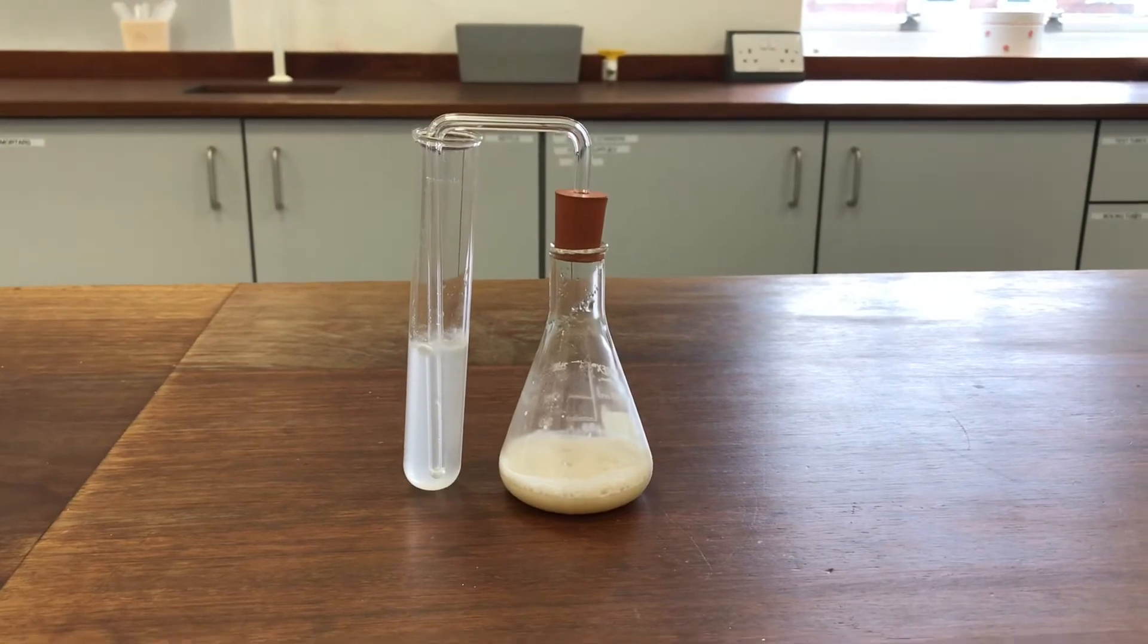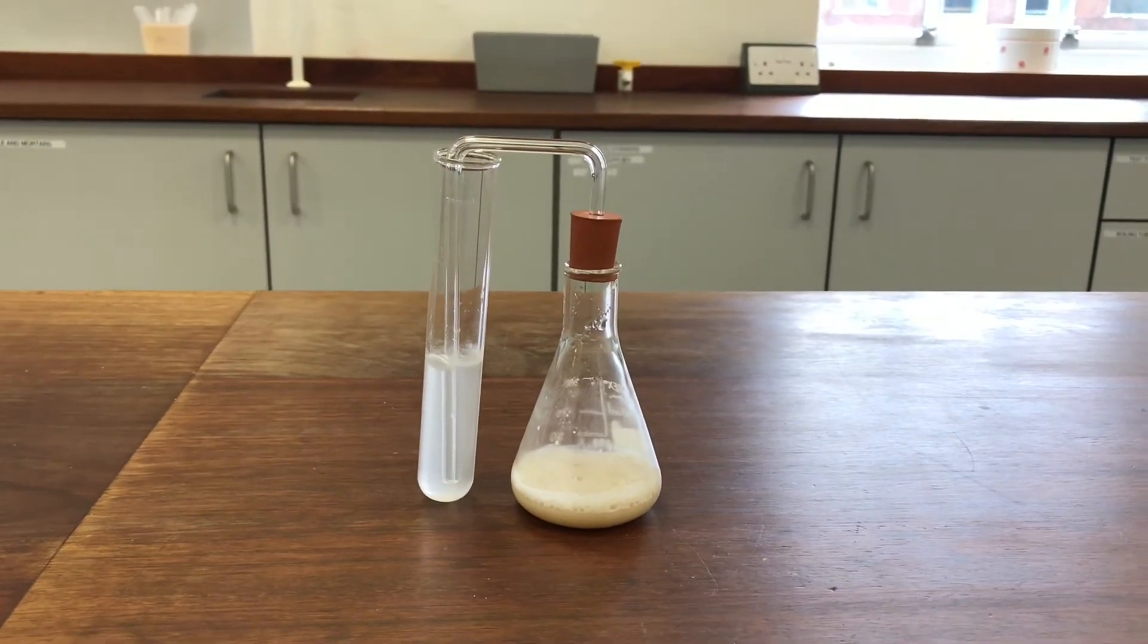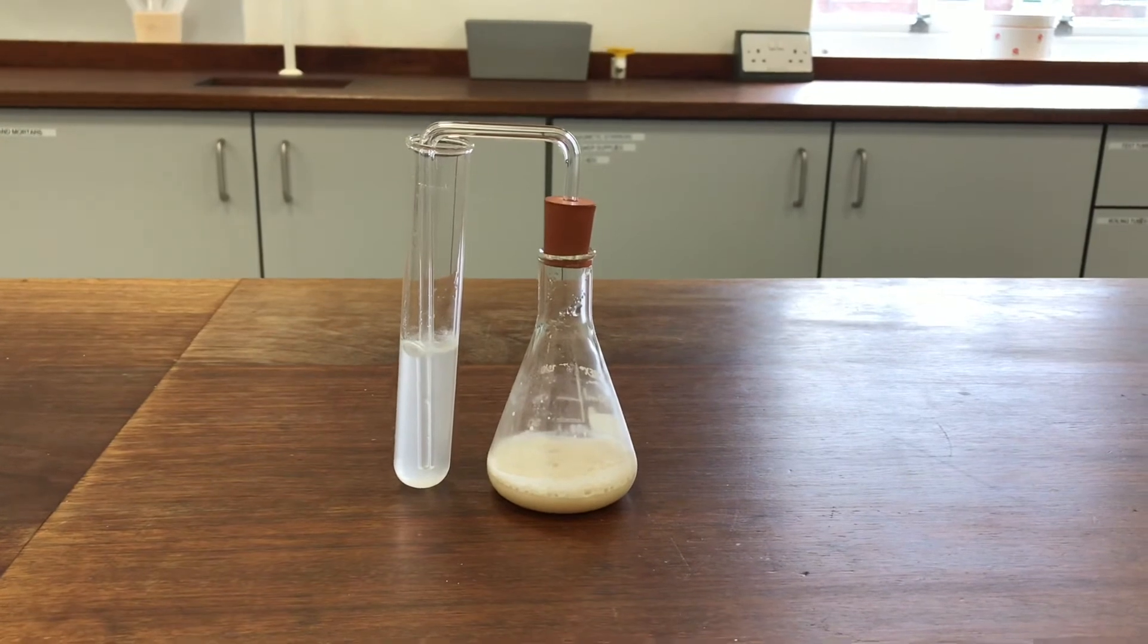Okay, so this is the experiment that we set up earlier with the yeast and sugar solution. And you can see that it's bubbling away really nicely there.